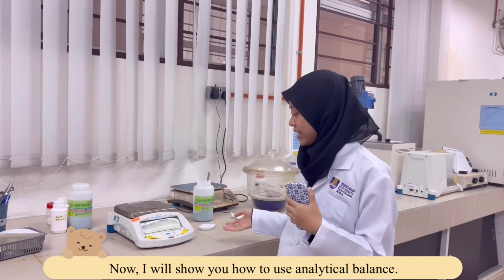Okay, that's all from me. Thank you. Okay, now I will show you how to use the analytical balance.